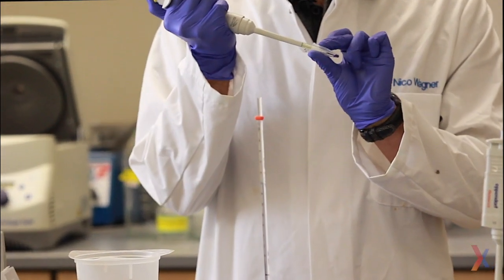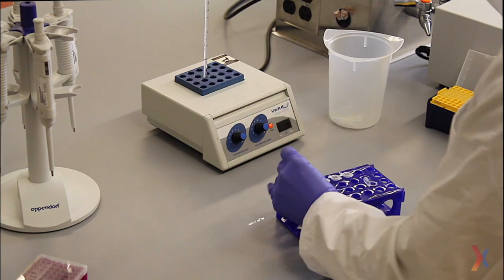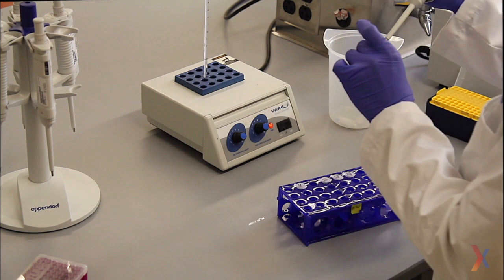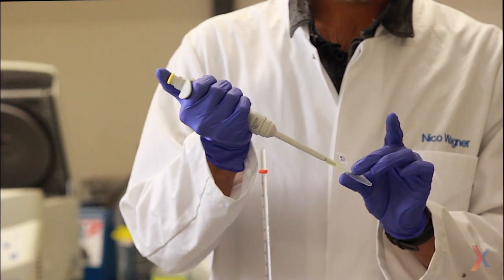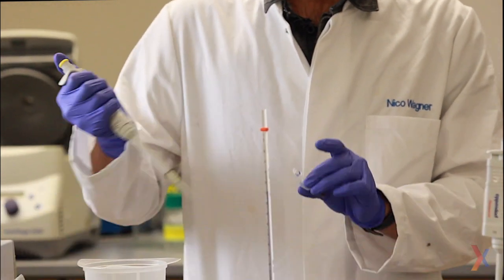Add it into here, and I like to use the pipette to already mix the sample and the reducing buffer. To prevent cross-contamination, I'm using a new tip for each sample. And I repeat the same process for the final two samples as well.